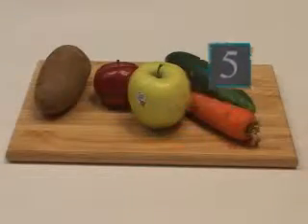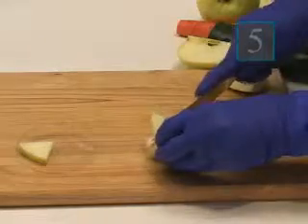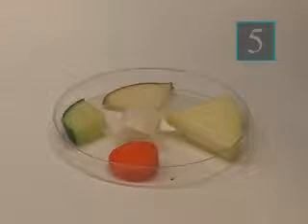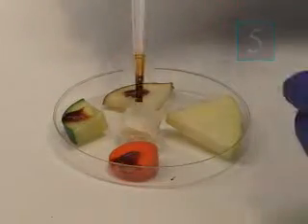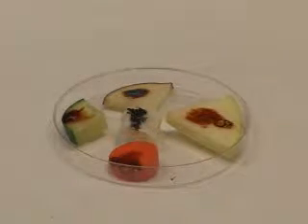Check for starch content by adding a drop of iodine to various vegetables and fruits, such as slices of potato, yams, apples, pears, carrots, celery, banana, oranges, bread, rice, or pasta, and any other foods that may be available to you. Which of the foods contains starch based on the appearance of a blue color? Record your results based on your observations.